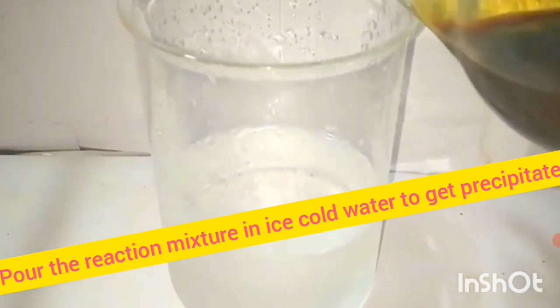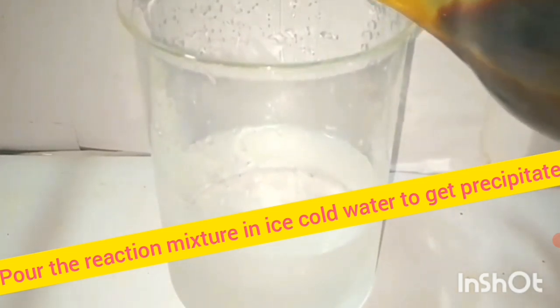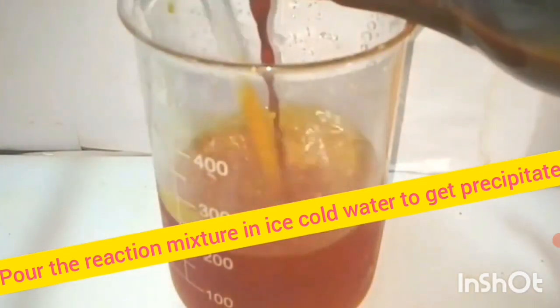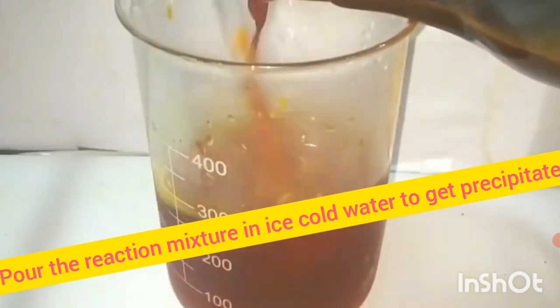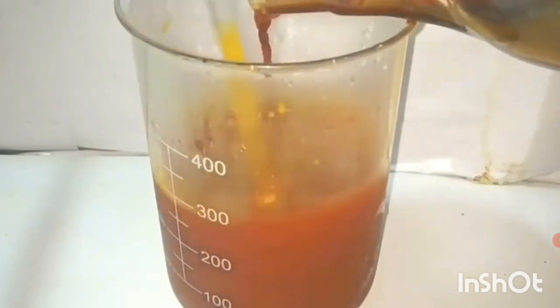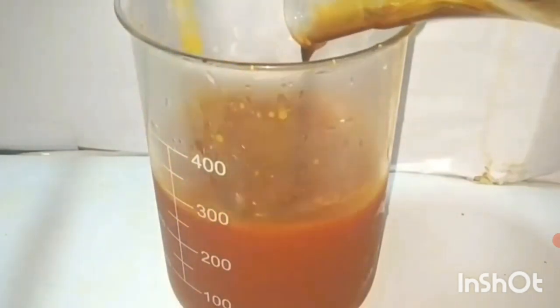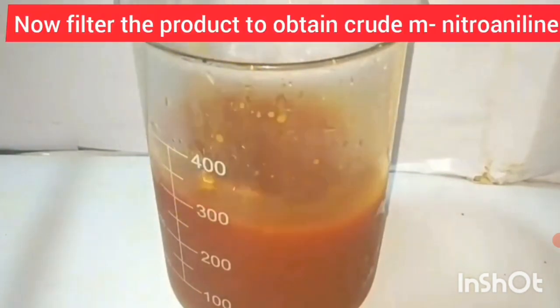The concentrated reaction mixture is then poured onto ice-cold water, so that a precipitate of M-nitroaniline is obtained. Stir vigorously so that crude solid M-nitroaniline is obtained as a precipitate.